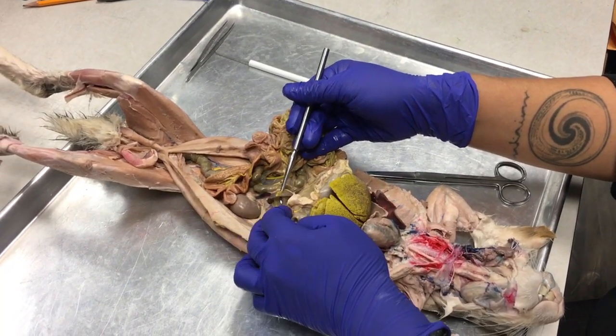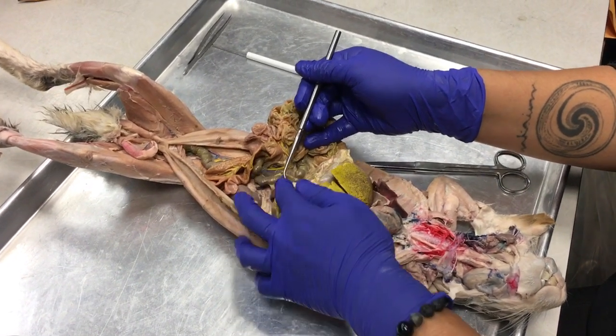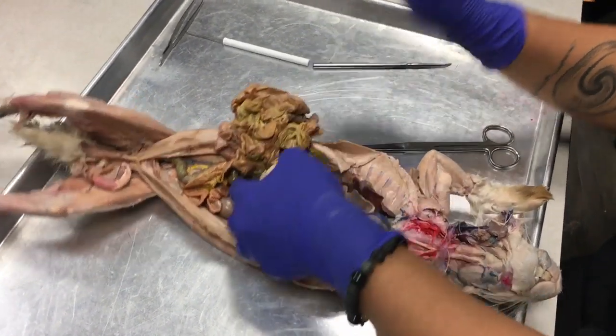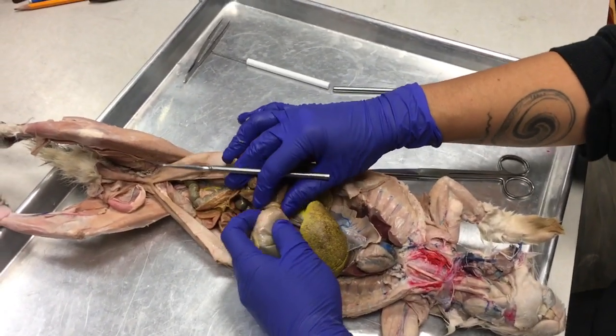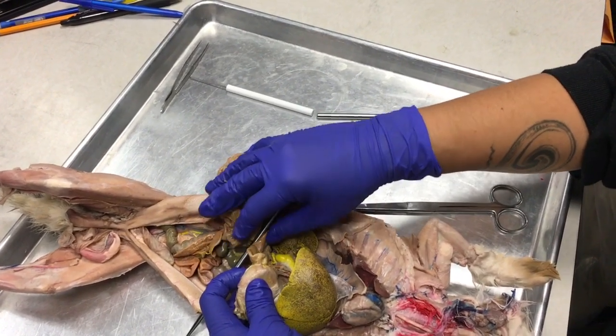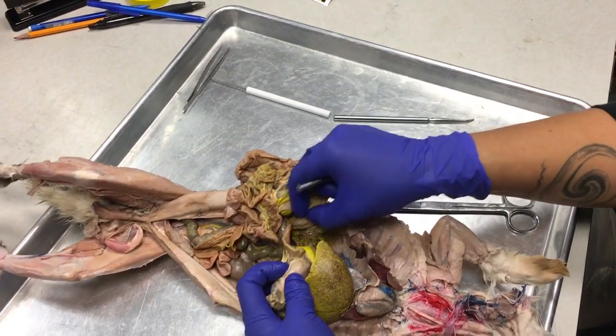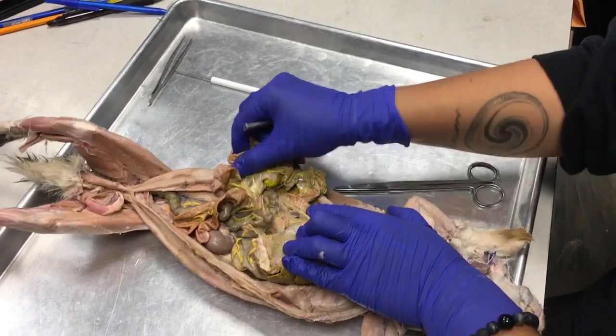All right, so look at this thing on the stomach. Spleen. Spleen. Okay, that's close. Okay, so look, I'm going to follow the stomach around and look. Pinch. Pyloric sphincter. Okay, so this must be the duodenum, right? Yeah. Okay, now I'm going to look in the mesentery here.